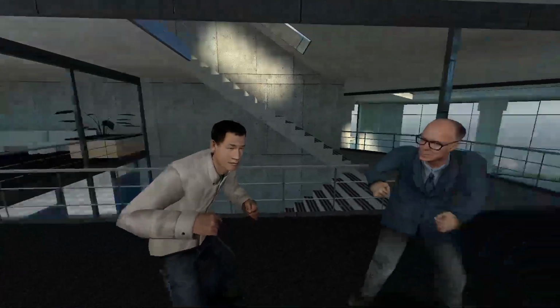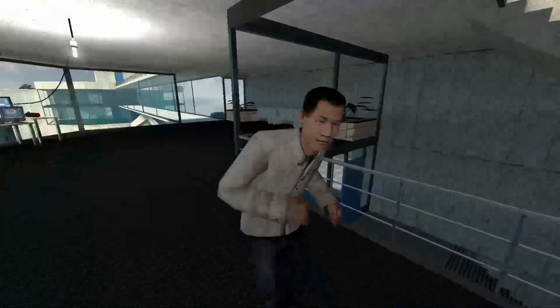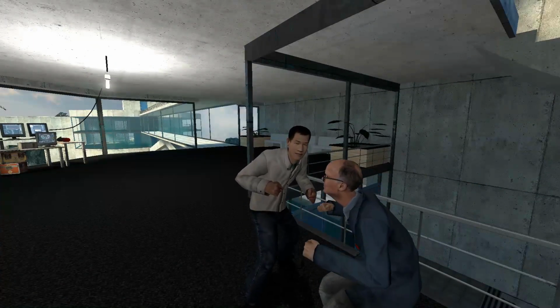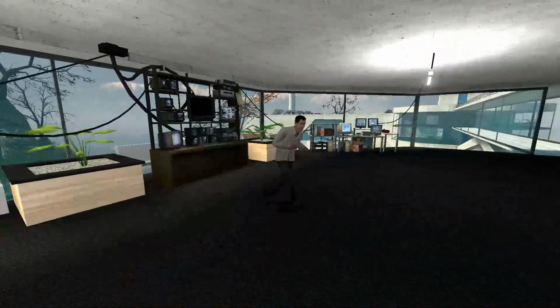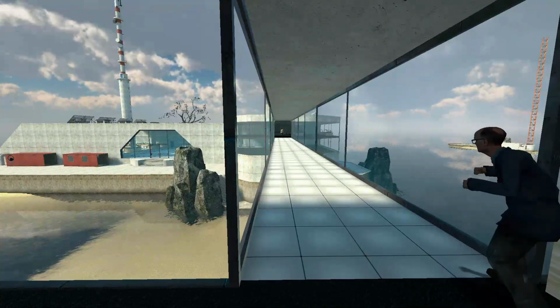I needed that! Oh my god. You didn't read the rulebook! Why didn't you read the rulebook? Gabe! I didn't know there was a rulebook. There's a rulebook. You took a test on it before you were hired. What? Oh, well, I must not remember. Let me go put on some goggles, because chemicals can get in your eye and you can go blind.